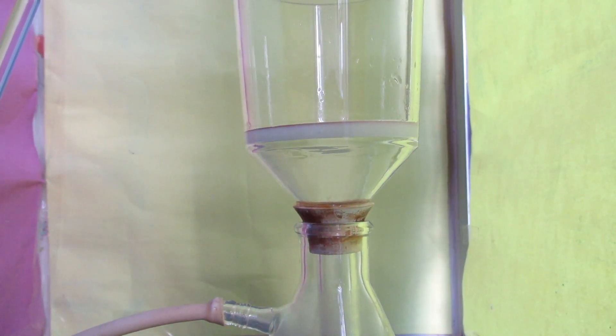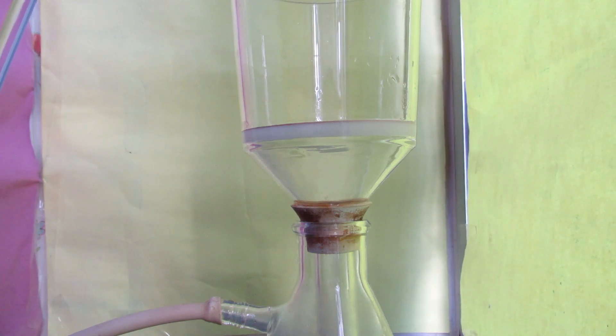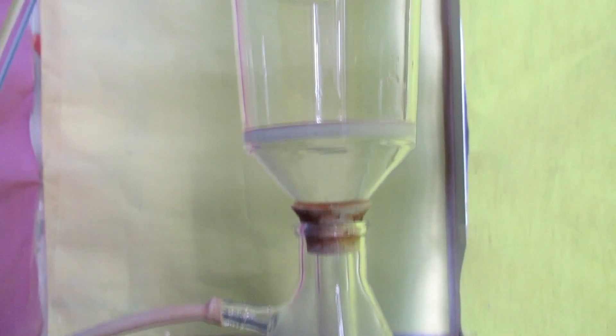Then a vacuum filtration was carried out to separate the red copper oxide from the mixture. I am very sorry that the video is shaking because of my vacuum pump.